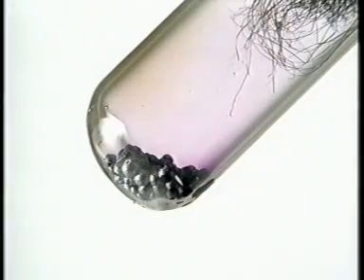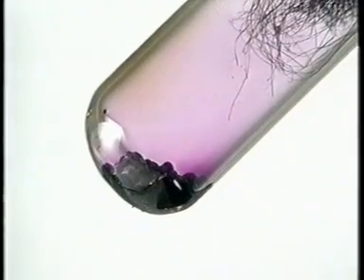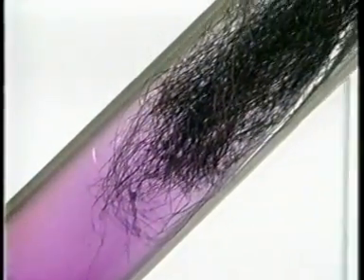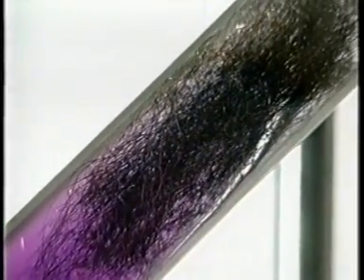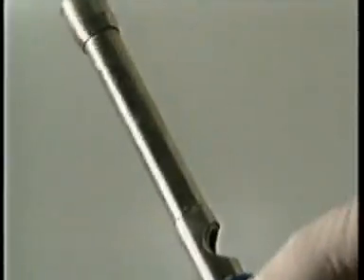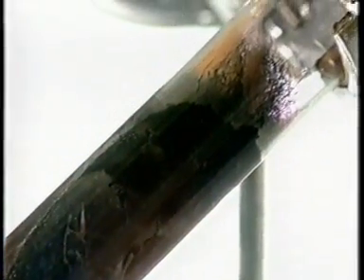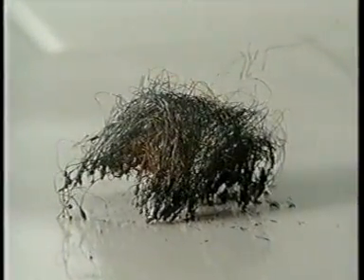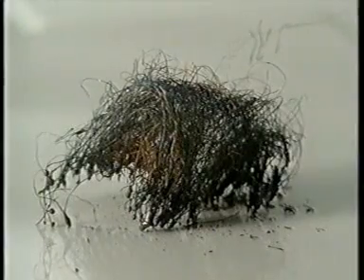This is iron wool. For it to react with iodine, it's placed above a few crystals in a boiling tube, in a fume cupboard. Heating the iodine turns it into a vapour. A Bunsen flame gets the reaction going. After several minutes of strong heating, only a small amount of the iron has reacted. It's become coated with reddish-brown iron iodide.